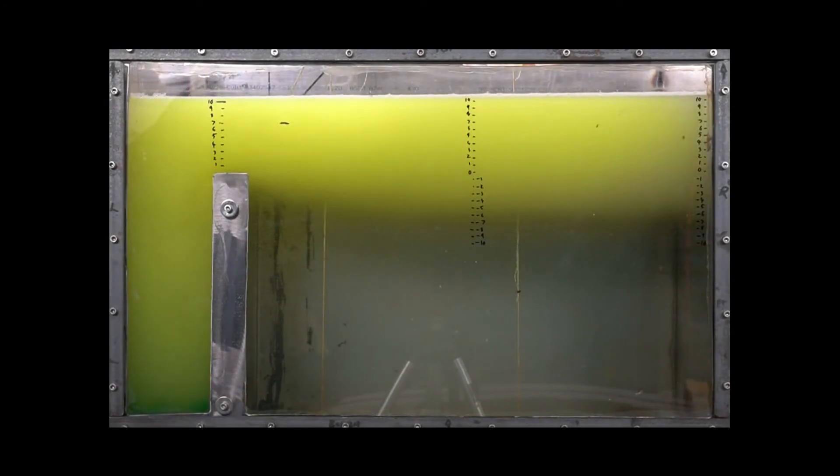Our goal in recording these videos through the viewing window of the tank is to characterize how our lab scale DAF tank works.